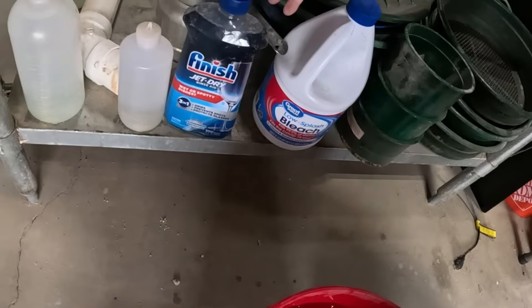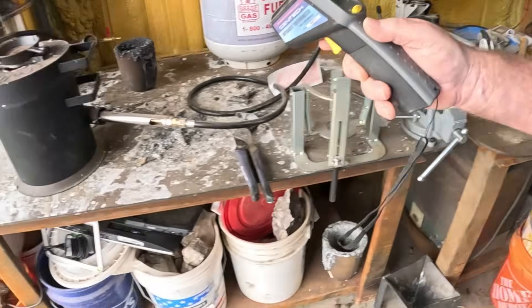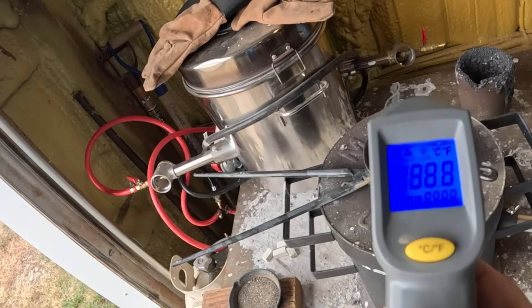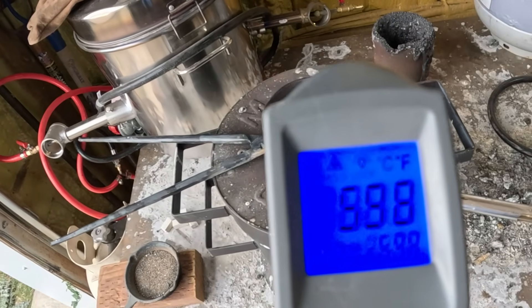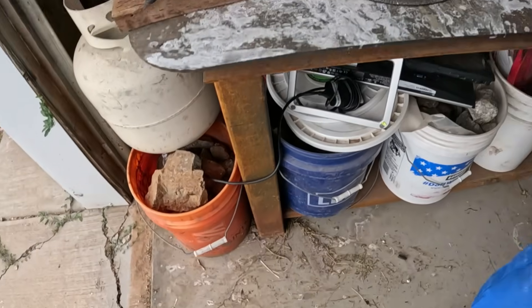A little update over here — let's go check the temperature. It looks like we're a little over 600 degrees. So when we get that up to a thousand, we'll go about another 15 or 20 minutes — it's about 25 minutes total. We'll go about 15 minutes once it hits a thousand degrees, and then we'll pour it in the water.